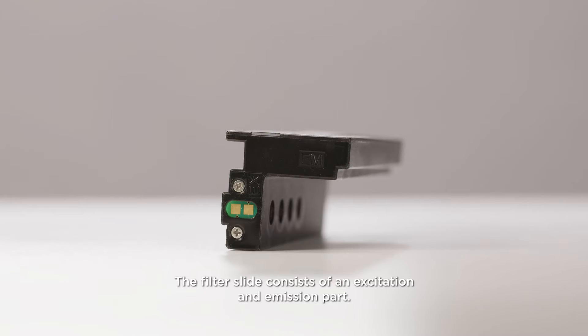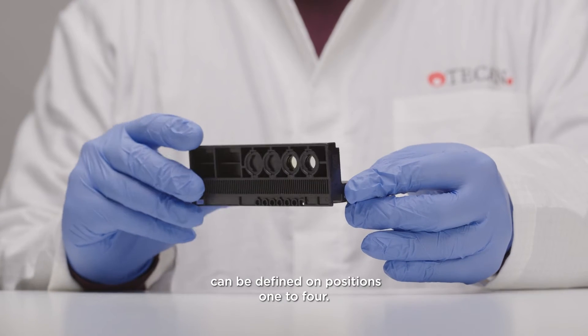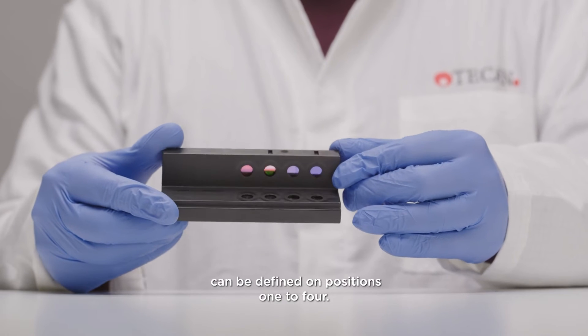The filter slide consists of an excitation and emission part. Up to four independent excitation and emission filter pairs can be defined on positions 1 to 4.